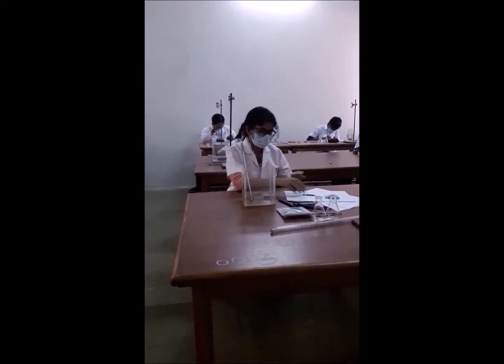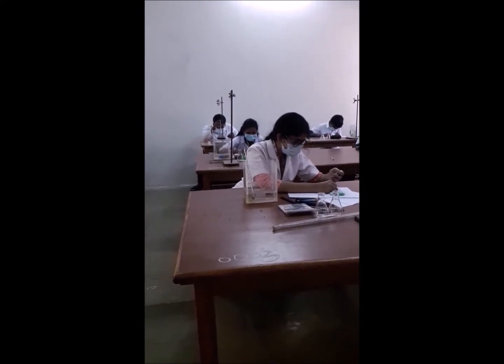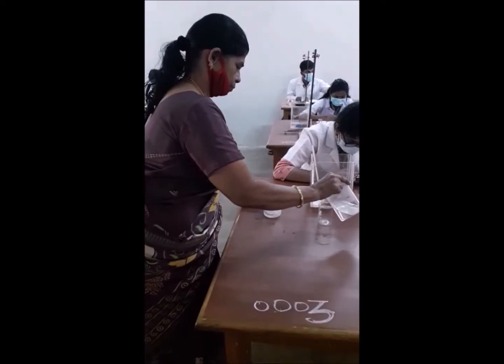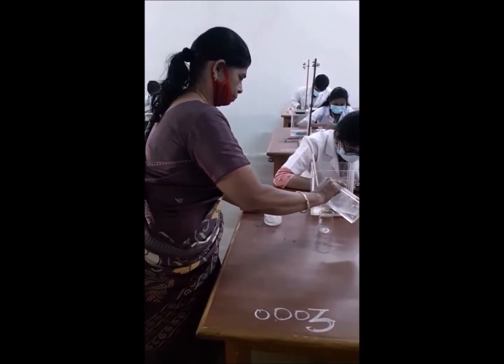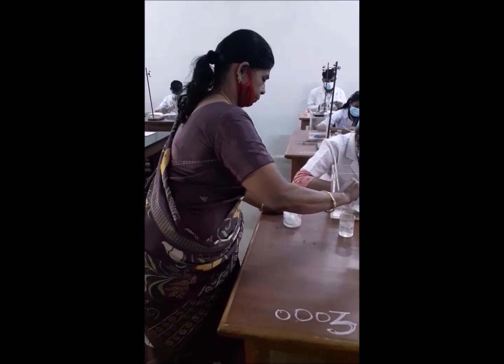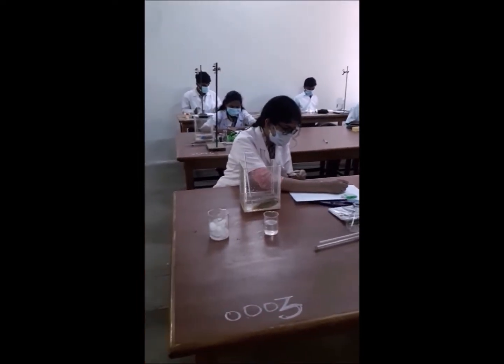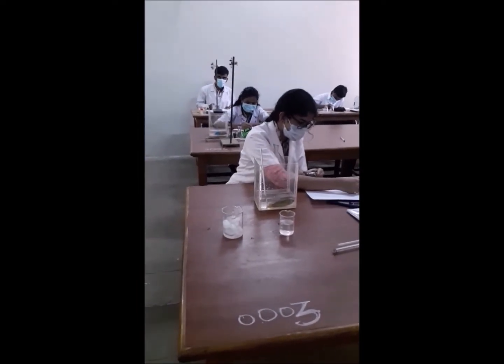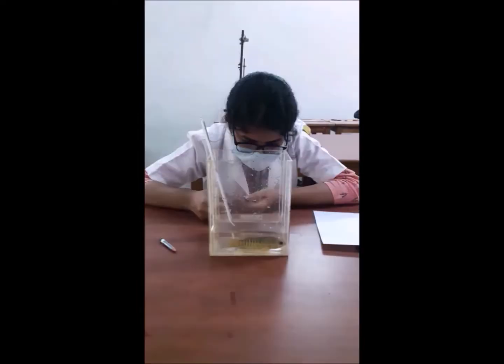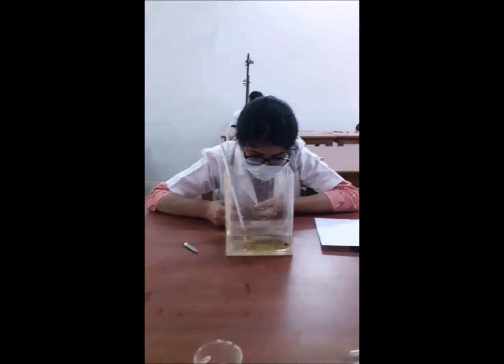Note the time taken for 50 opercular movements and take three trials. Use hot water to increase the temperature of the water and ice cubes to decrease the water temperature. Note the time required for 50 opercular movements at different temperatures and record the values.